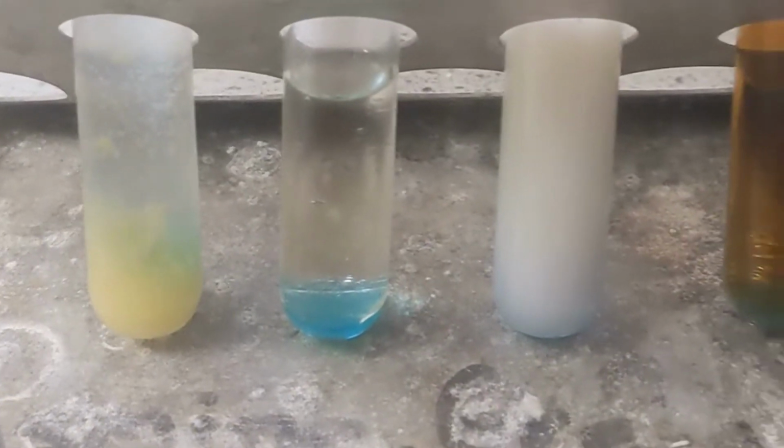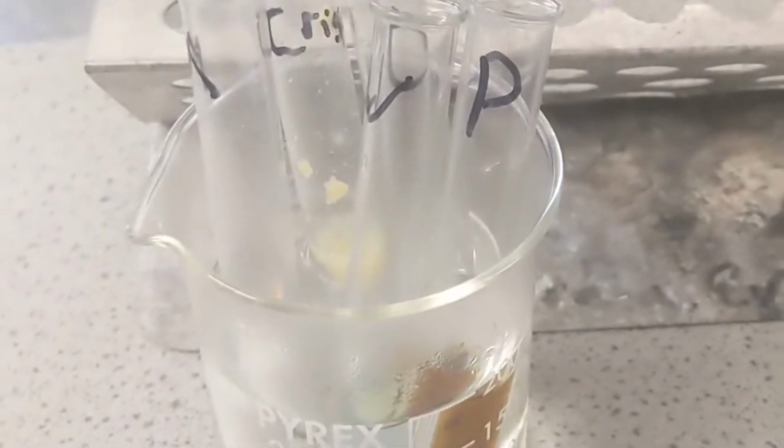That's because this takes one extra step to our other test. We need to add heat. If you're not sure how you're going to remember that, let's go back to that Doctor Strange thing. We're going to keep going with it until it's run out of any juice. If I look at the magic portals that he's opening, I look at those sparks, I think they probably would give off some heat, right? Sparks give off heat. I add heat to my Benedict solution. I have to add heat to it.